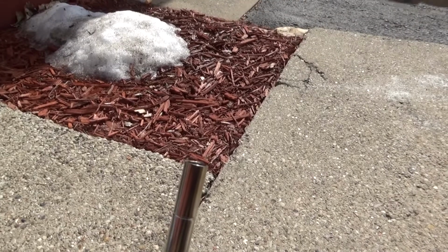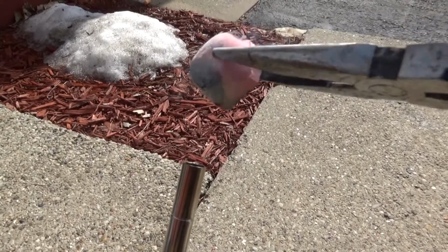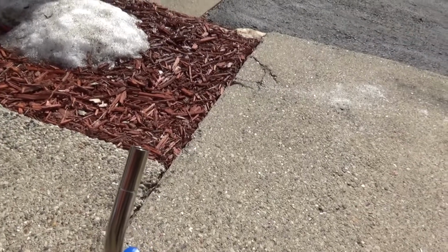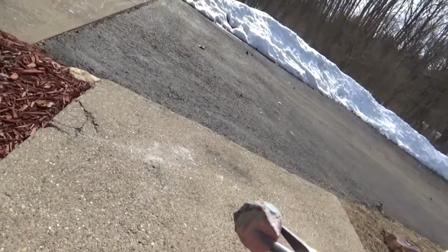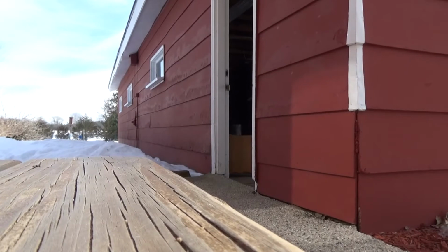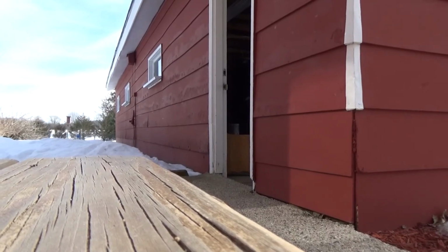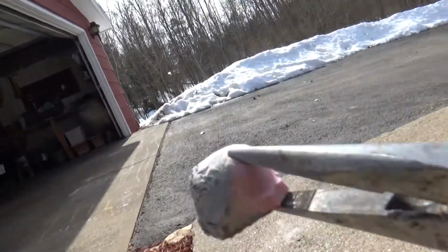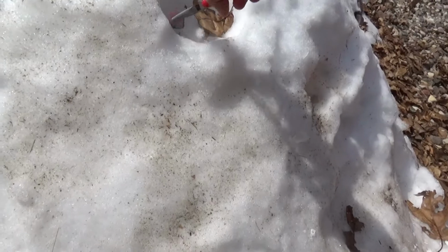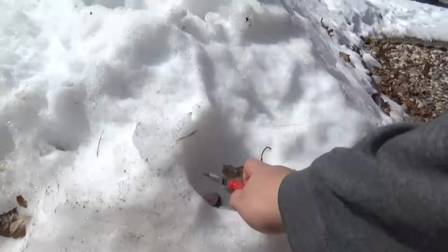It actually smells kind of nice, surprisingly. Although I wouldn't recommend... Is that on fire? Oh, I think it's on fire. Yeah, that's on fire. Alright. So make sure you don't stick it in propane, at least. Obviously. Well, there you go. That probably isn't very good to breathe in. So I'm actually going to quench that right now. Just stick her in the snow. Have that quench right up.